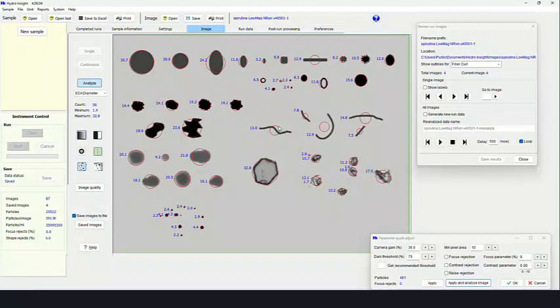So for fibers, if you use a system that assumes particles are round, as equivalent circular area diameter is doing here, you'll notice that we'll put a model around every fiber or every crystal shape. And in some cases, this is about a 13 micron particle, this is about a 12. You can obviously tell that using a model that assumes a particle is round is a bit misleading when it comes to analysis of fibers.